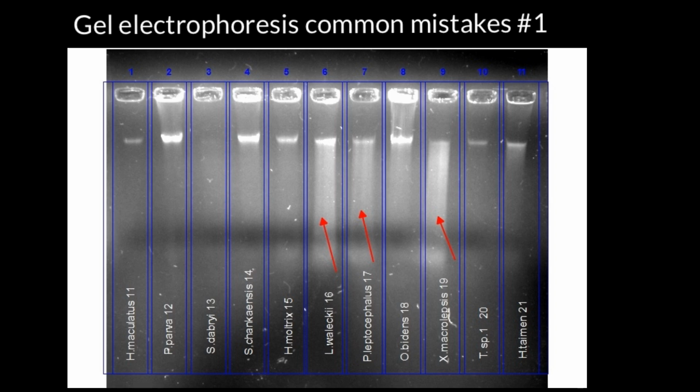This is going to be my first video in a series of videos, and if you study biology, genetics or microbiology, running gel electrophoresis would be just a part of your routine, and of course you would make mistakes. And one of the common mistakes would be to get a gel picture like this, where we have a smear. So how can this be explained?